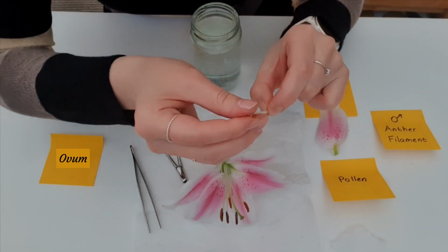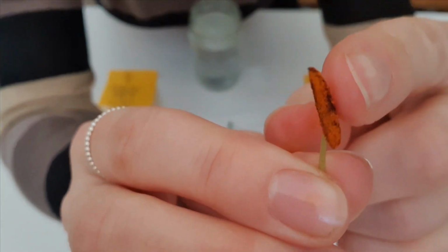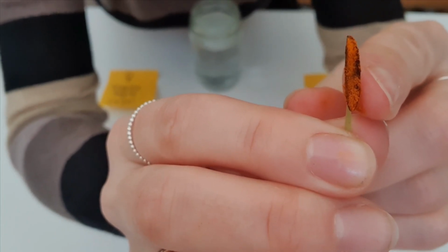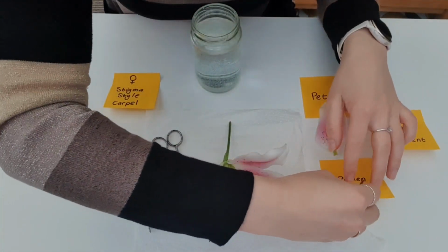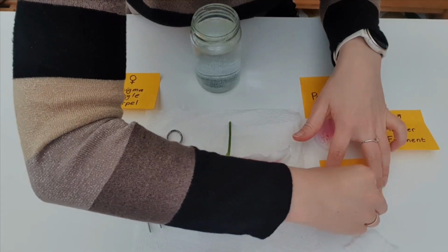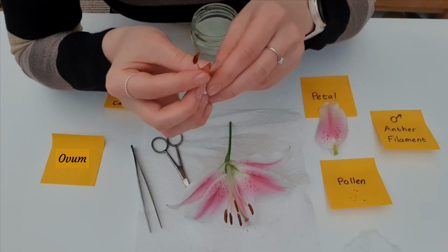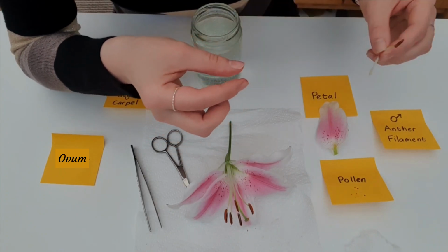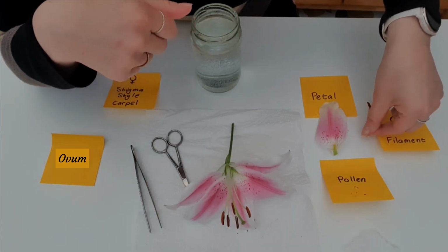And just to show you on the camera, I don't know if you can pick that up there, you can see there's quite a lot of pollen on this stamen, on the anther part. I'm just going to rub it on here. If you have a microscope at home, you'll be able to look at that under the microscope and see the actual pollen grains, but they have to be really fine. I've got bits that are in two bigger chunks there.